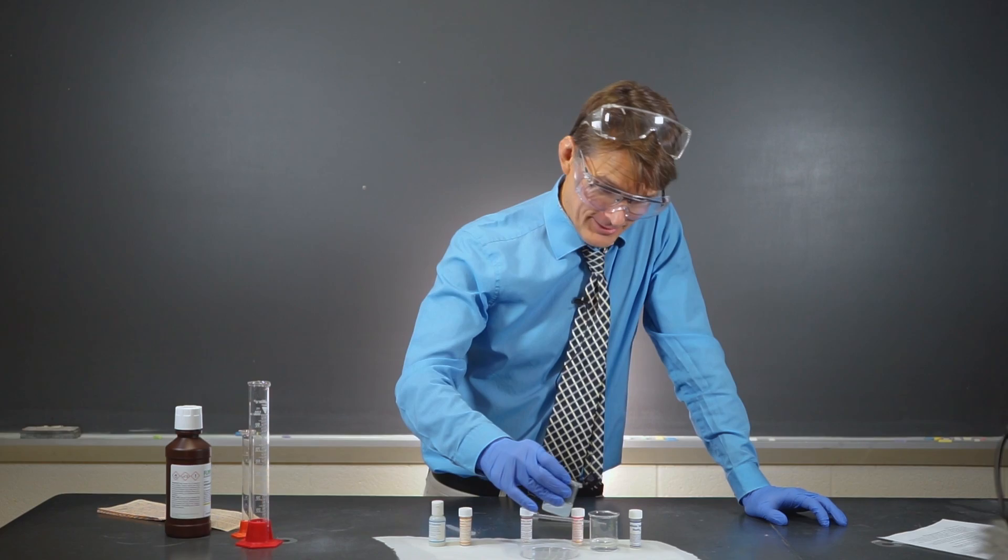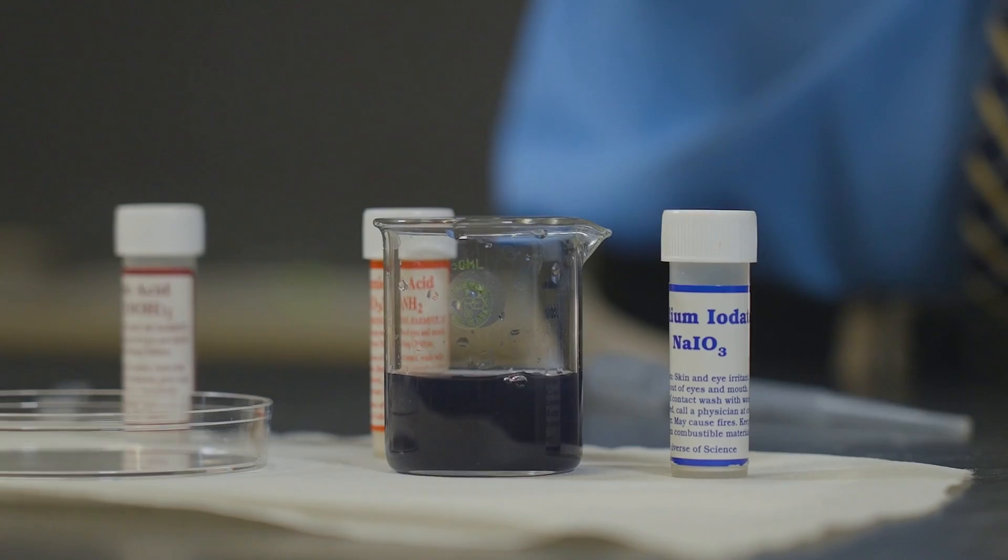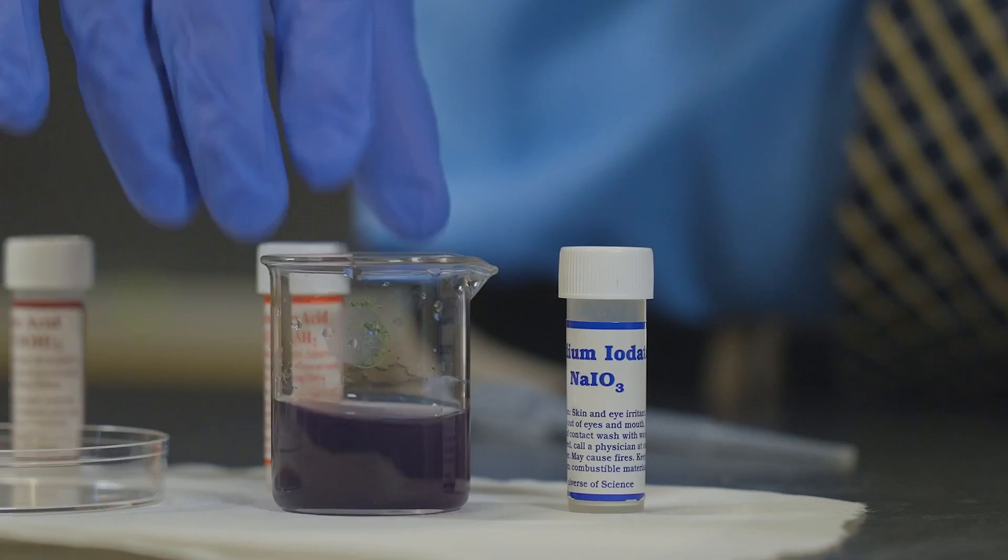Let's see. You ready to roll? Here we go. We got a little color change. Oh, look at that. We got the formation of iodine reacting with the starch to turn the blue color. And hopefully, there we go.